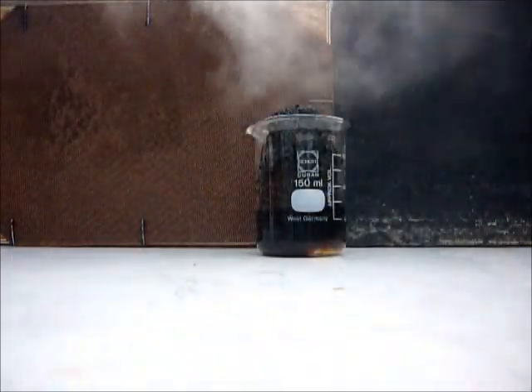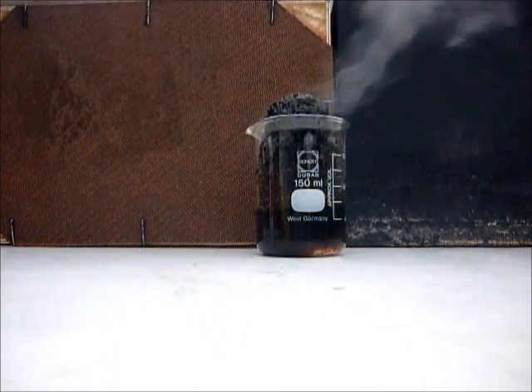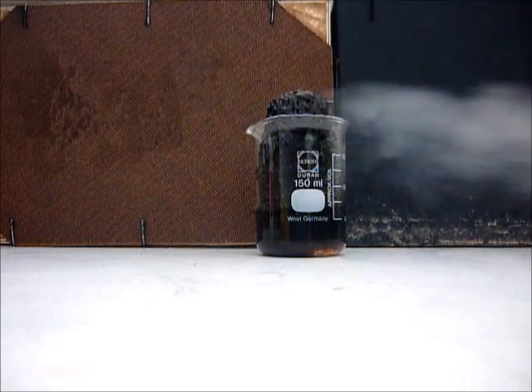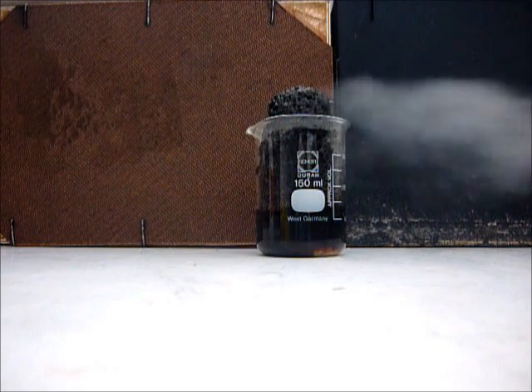The fume isn't healthy, so don't breathe it. Here you see a column of carbon.